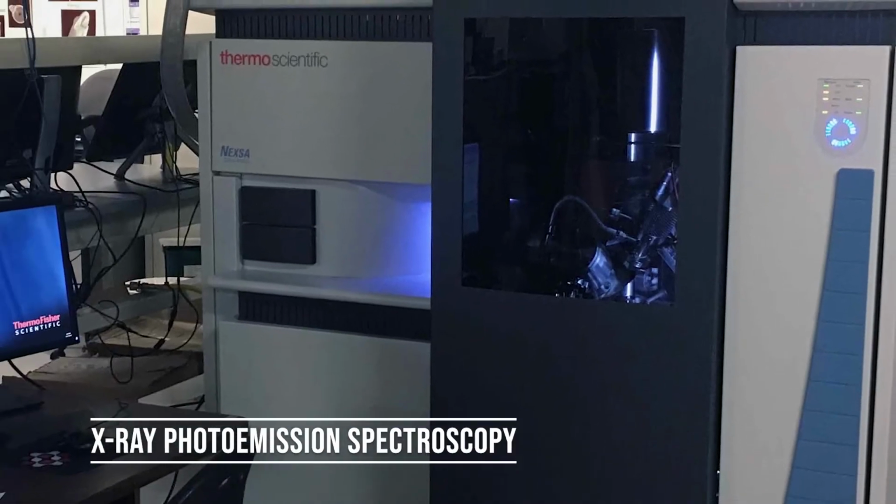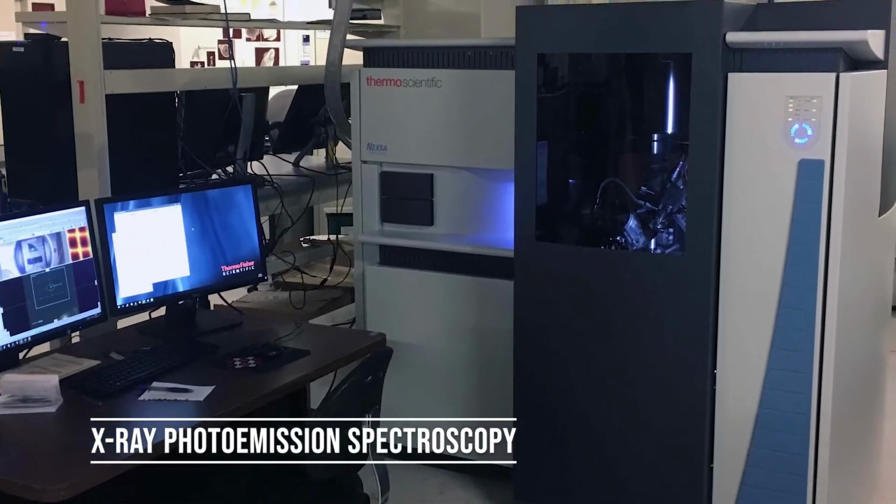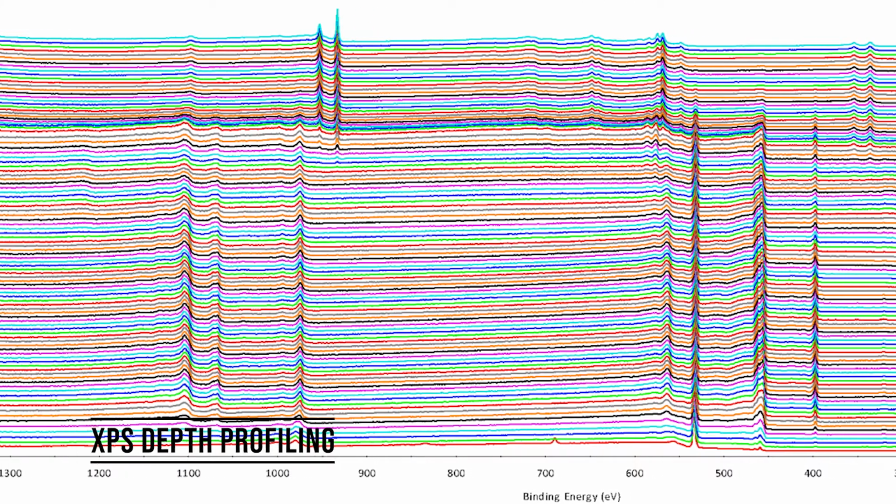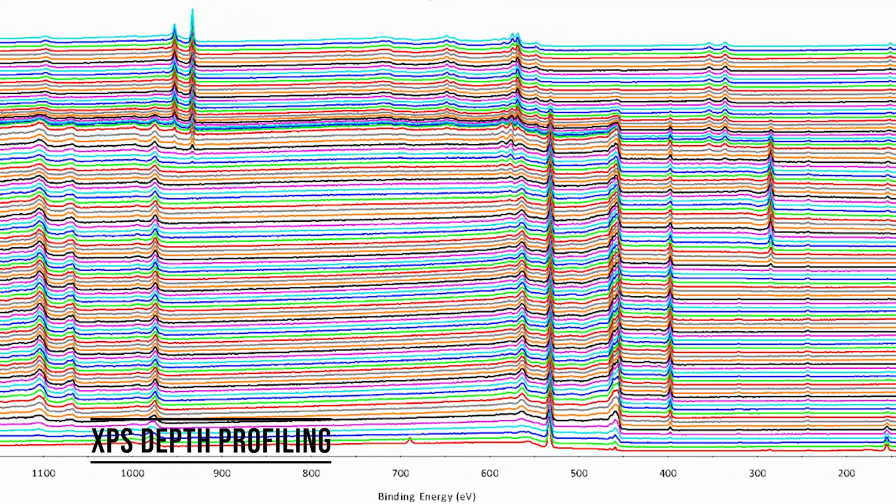X-ray photoemission spectroscopy, or XPS, is used to study local changes in chemical composition and species valence at specimen surfaces. Depth profiling adds an extra dimension to this technique.